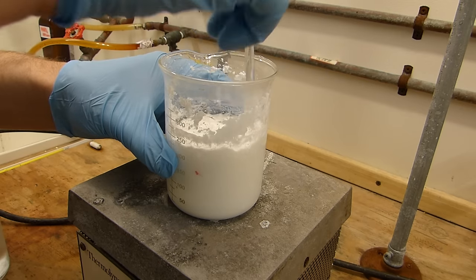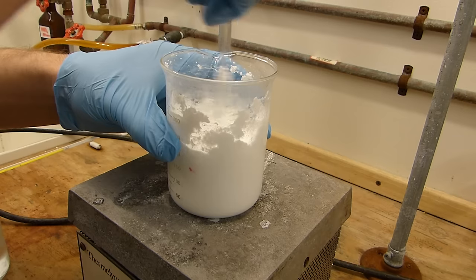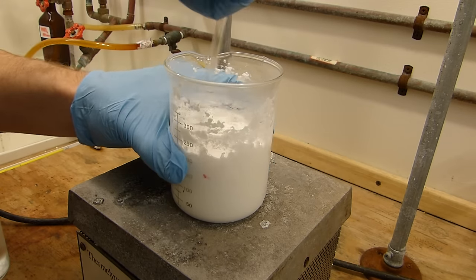And don't worry, just keep stirring it. It will eventually break the crystals enough that it will be liquid enough to pour and continue to make that stir, as you can see here.